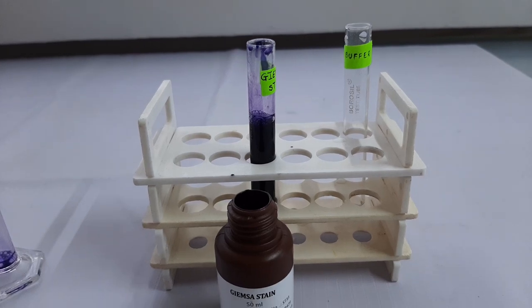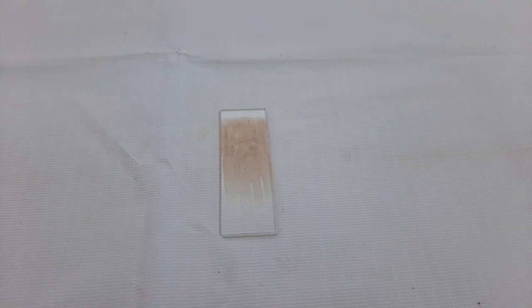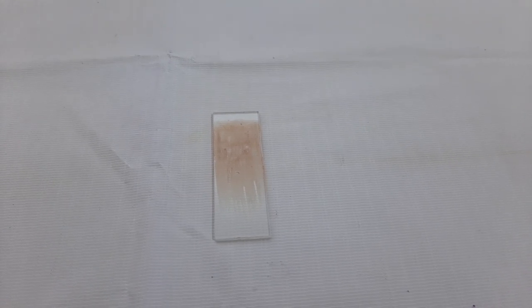Now our Giemsa stain is ready to use. So, now we can move ahead for the procedure.